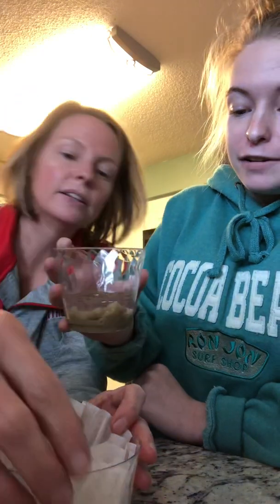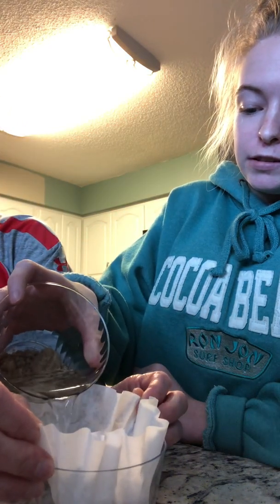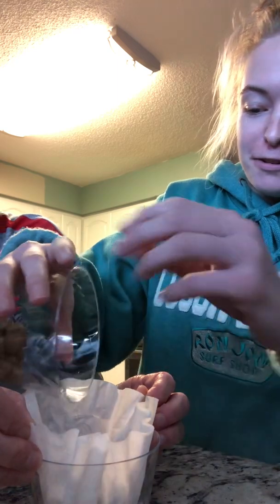Oops, did we? Oh, there we go. I always forget we have to hold it, get the whole thing in there. It's not going.